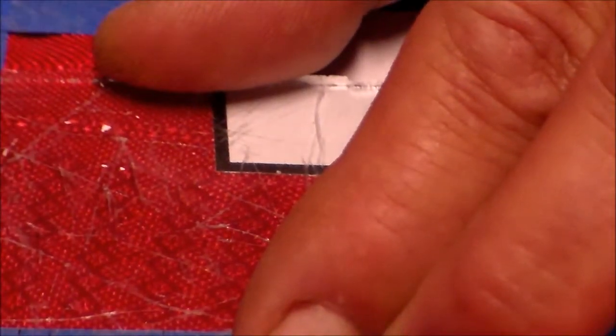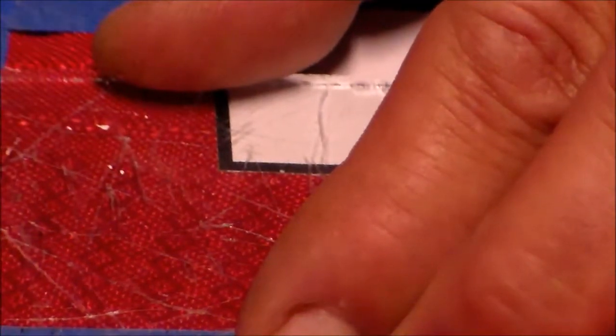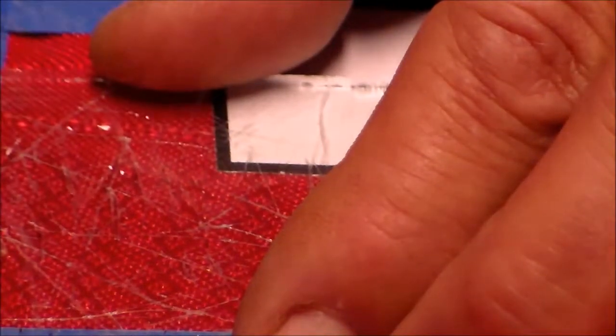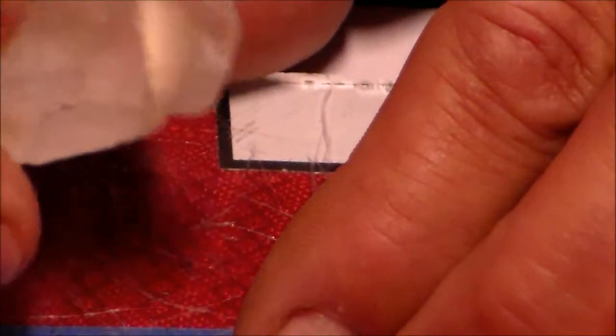That one really didn't leave a scratch, it was more powder. And you can hear that one actually scratched the glass plate. The last sample just flakes apart. So this is our hardest one out of our lighter minerals.